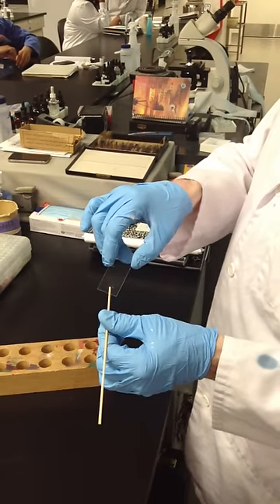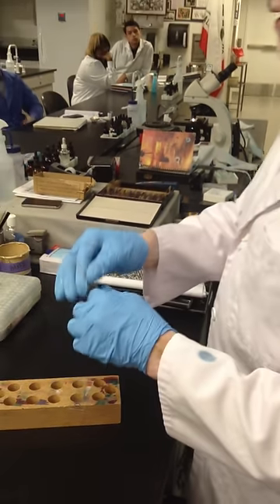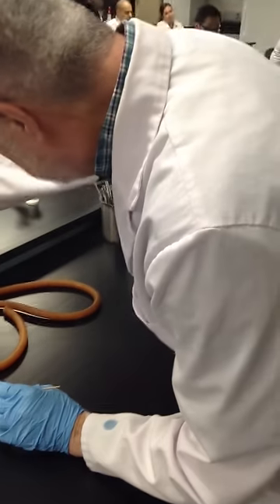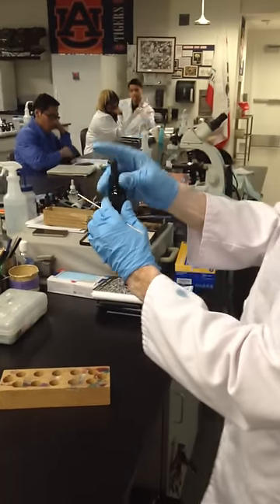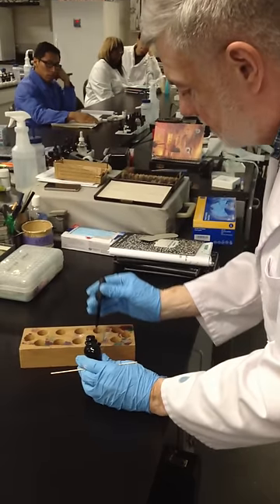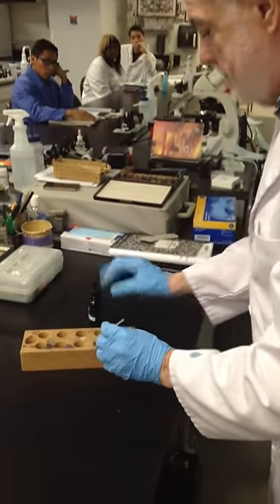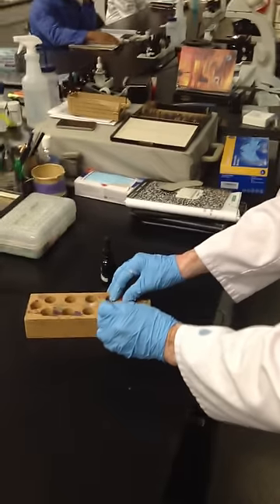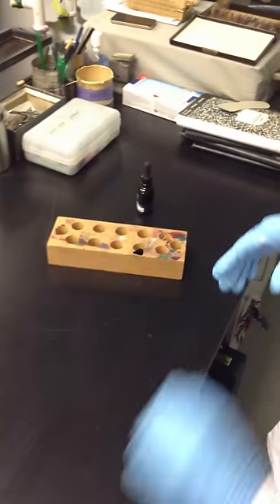Add a drop of nigrosin dye — it should be in front. Hold it by the glass because the tops disintegrate with the stains. Put one drop on top of the circle, then with your stick mix it with the tartar and break the stick.